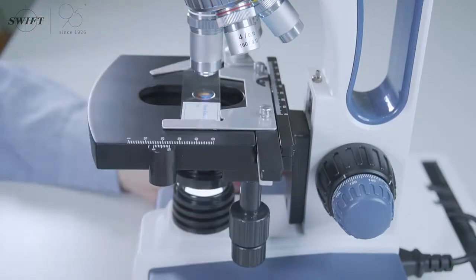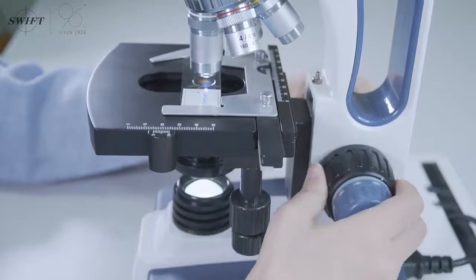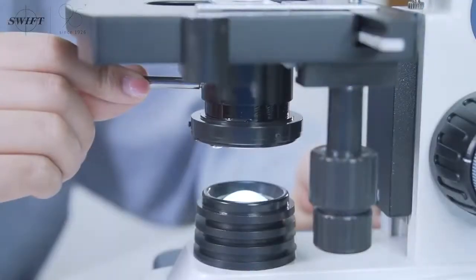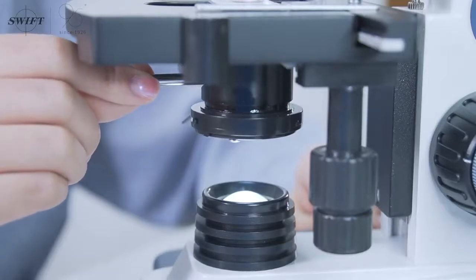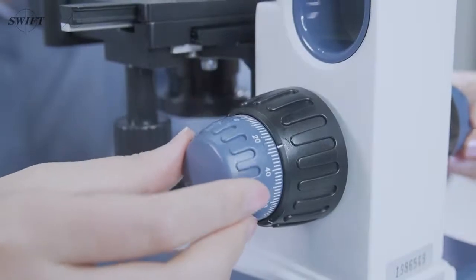Raise the platform and lightly tap it a few times to remove possible air bubbles at the front of the objective lens. Air bubbles will seriously affect the image quality under the microscope. Other operation methods are the same as high power objective lenses.